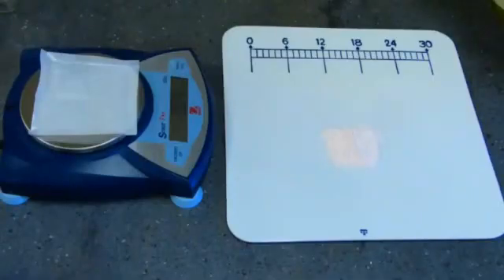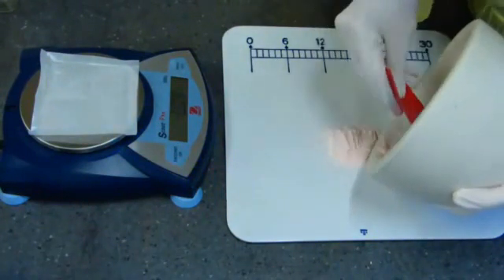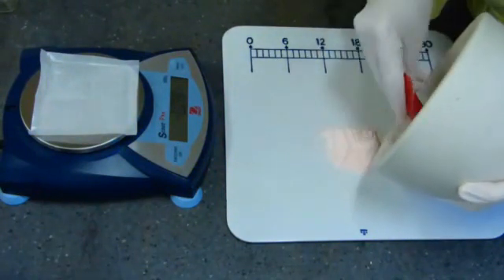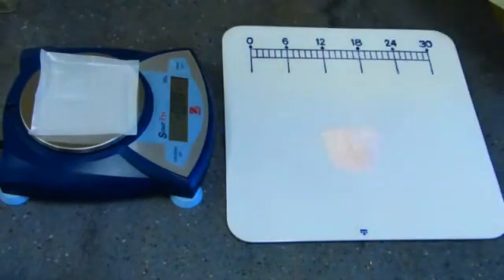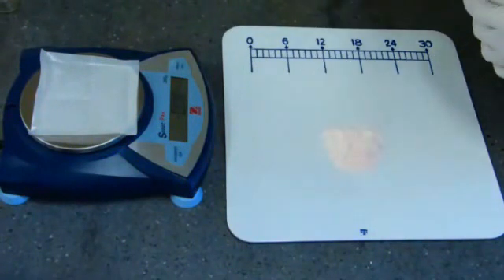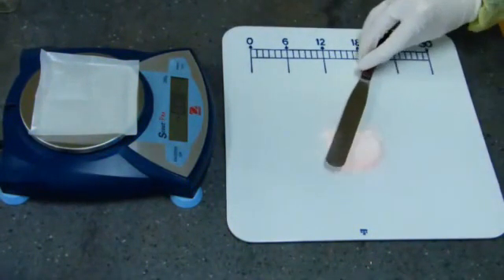After the ingredients have been triturated together, scrape all of the powder out of the mortar and transfer it onto the center of the pill tile. Gently pat the pile of powder flat with a spatula to make it easier to punch the capsules.